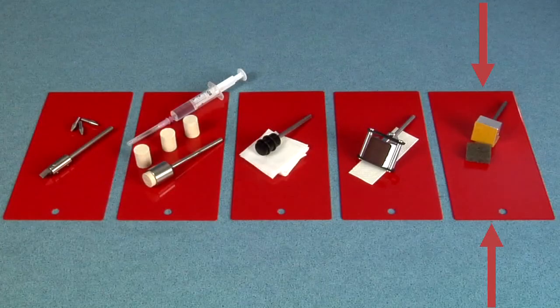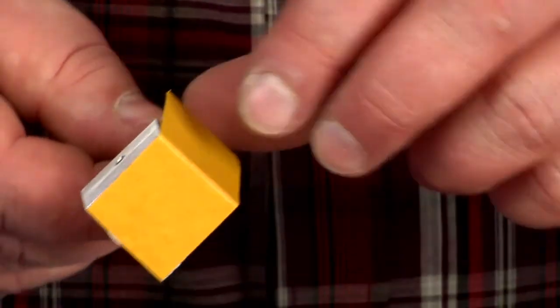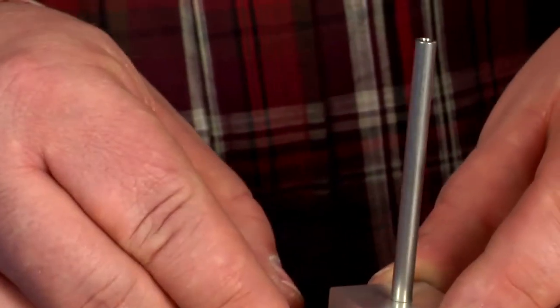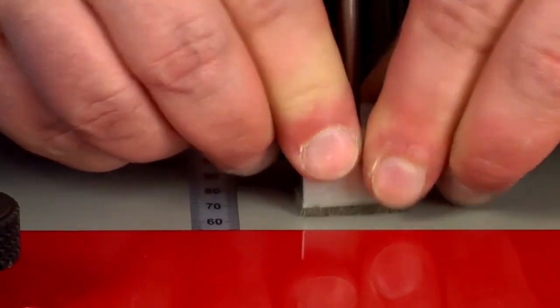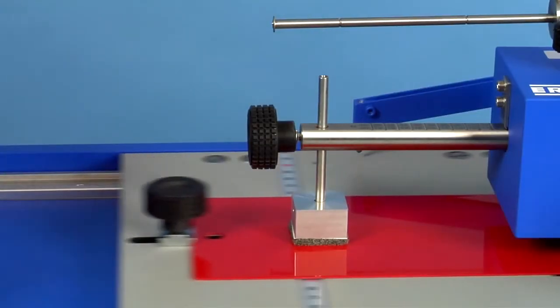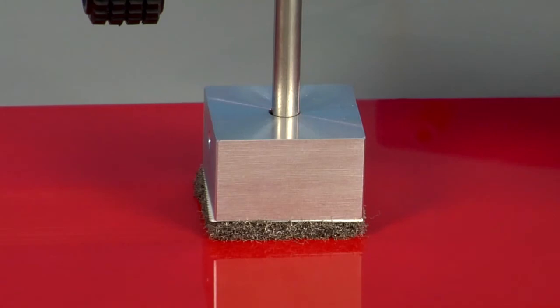For individual requirements within abrasion test matters, in principle an unlimited range of media can be fixed at the abrasion adapter. The desired abrasive media is fixed to the adapter simply by using common double-sided adhesive tape. The test begins by pressing the start button and runs until the number of adjusted cycles is fulfilled.